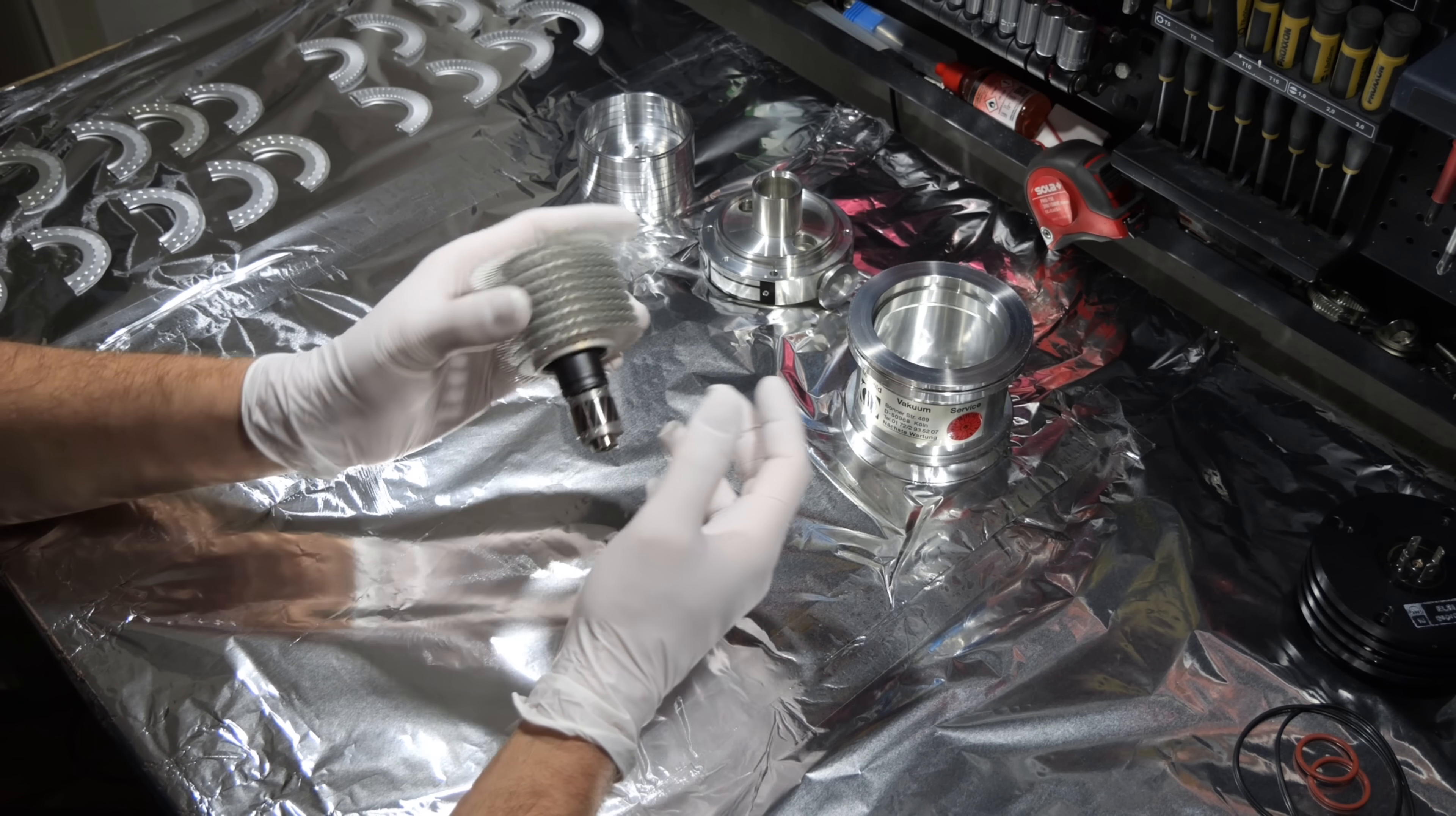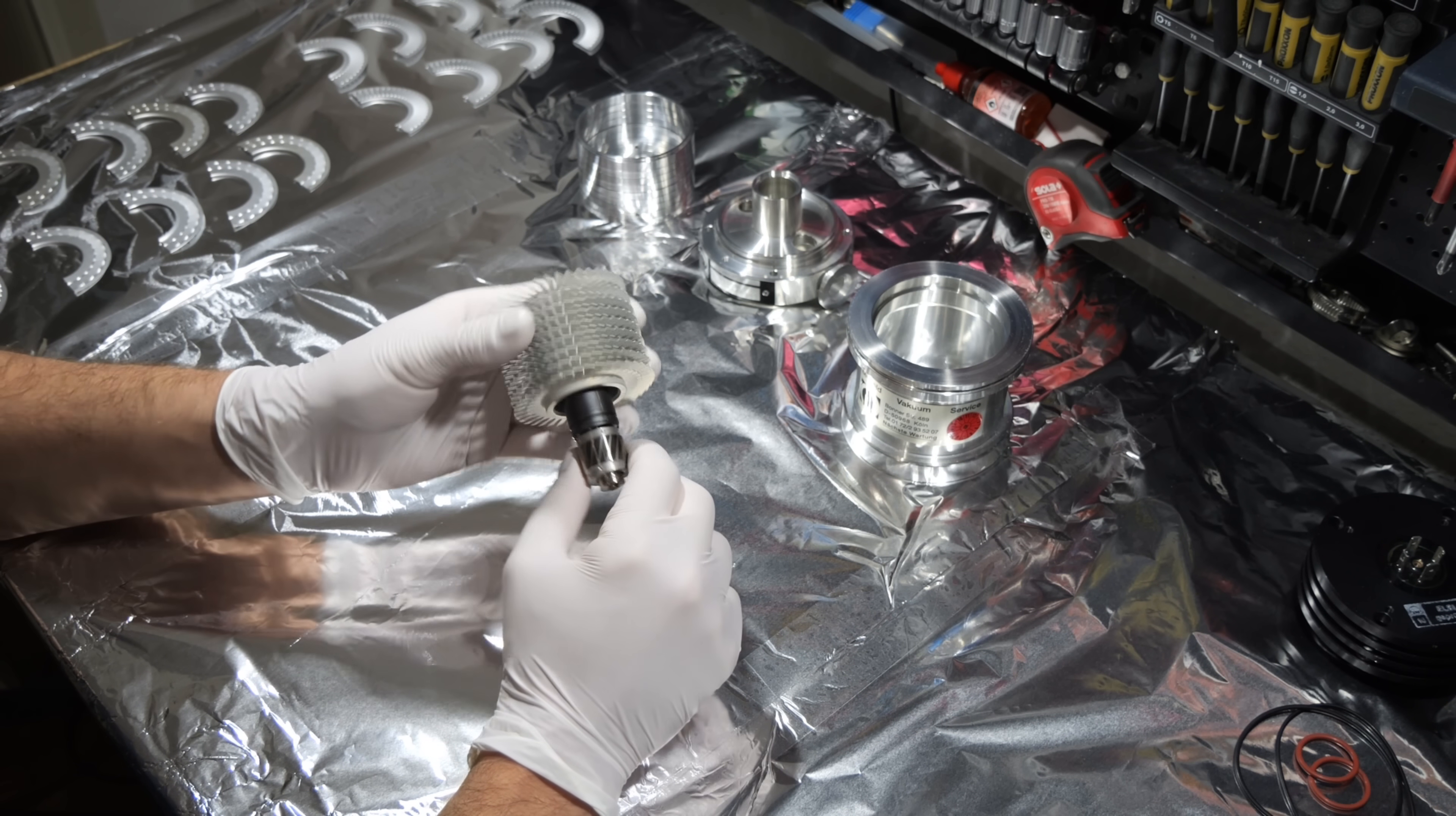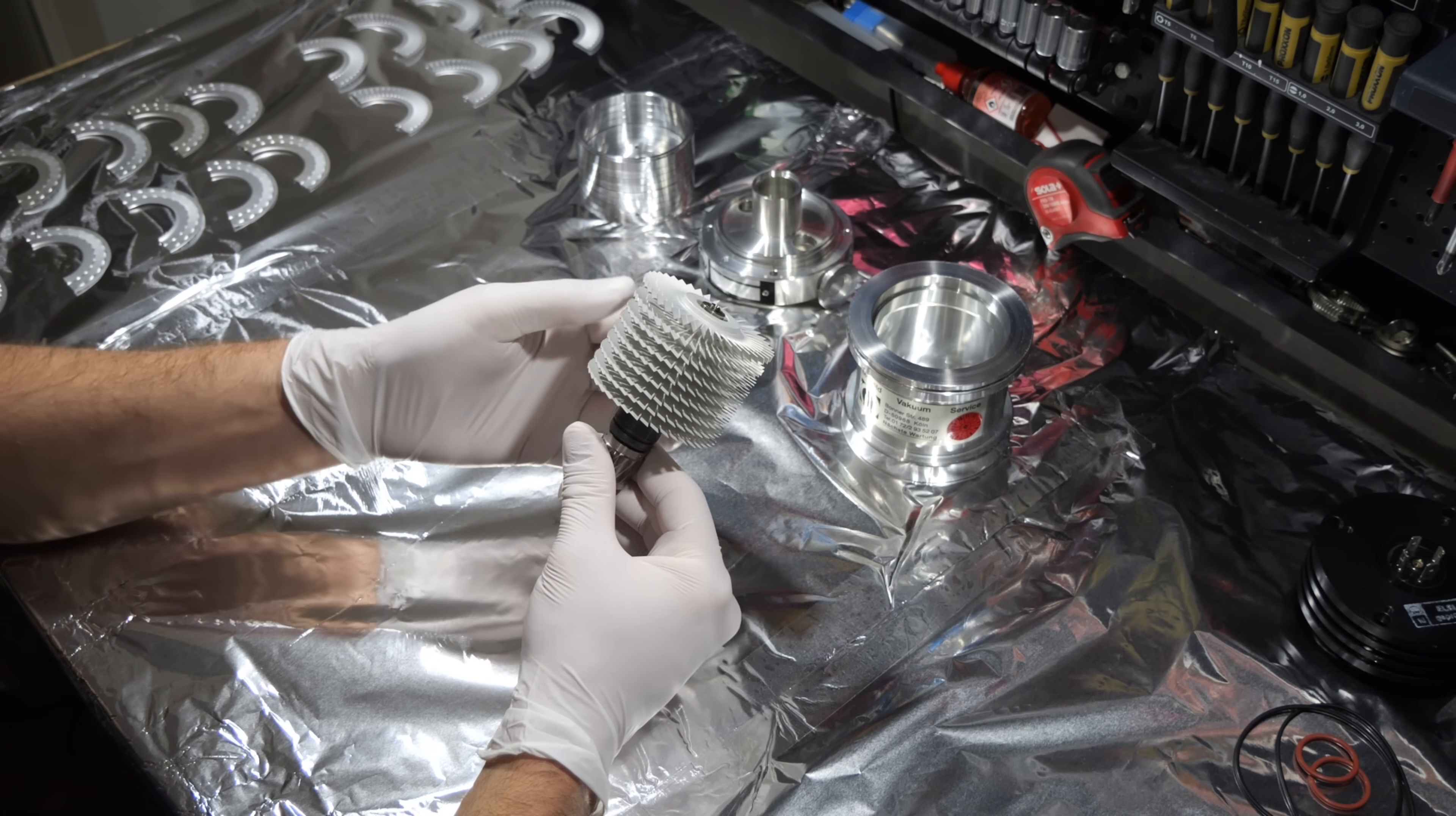I have decided not to disassemble the rotor and take off the bearings. I've tried to remove these nuts here but they are screwed down very tightly. I don't know the torque specification but I can't get them off and the bearing feels fine. I don't feel any roughness. So I think I will just try to keep it as one piece and I've simply washed the upper part of this rotor here.